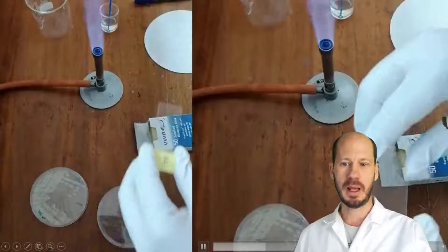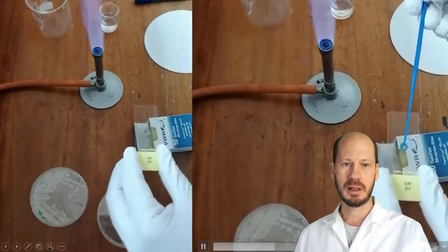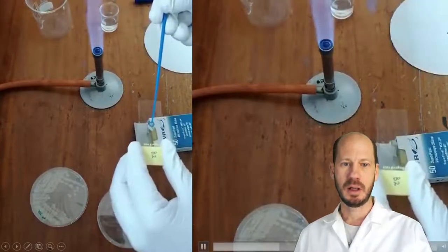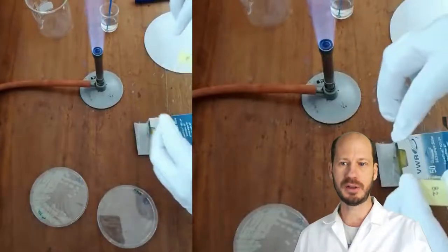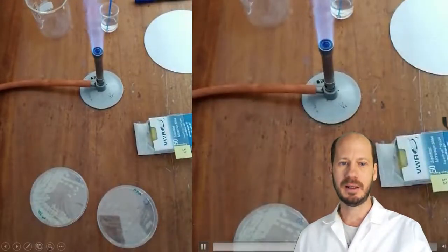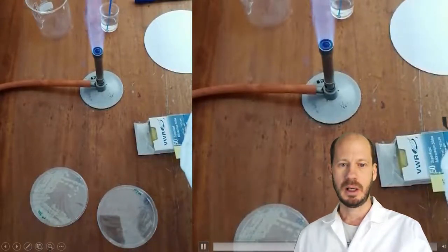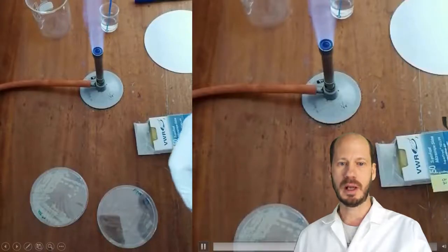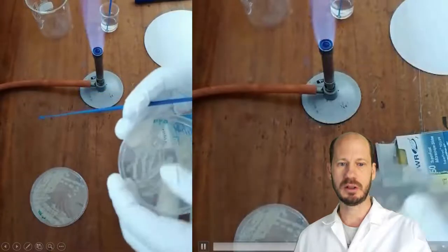Now we are going to transfer those cultures into a clean microscope slide. First, we add a drop of water. And over this drop of water, we are going to scratch the plates from the colony that we are isolating. And that scratching the plate will remove some cells. And we will be able to now place these cells over the slide.